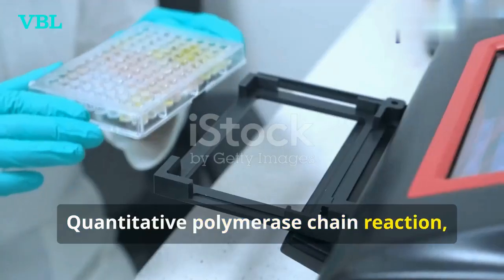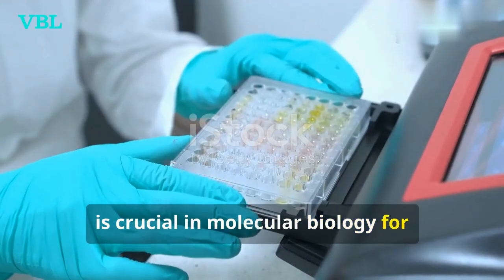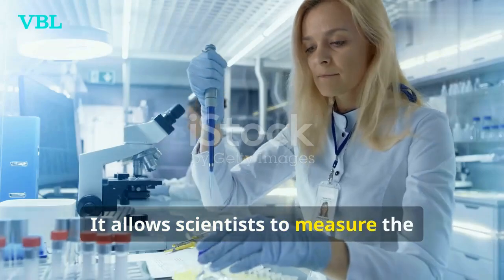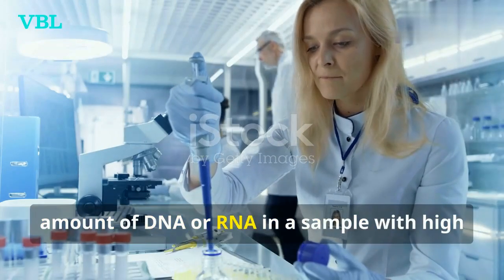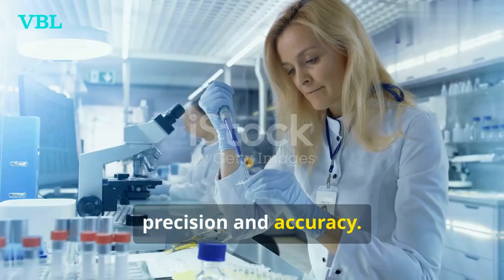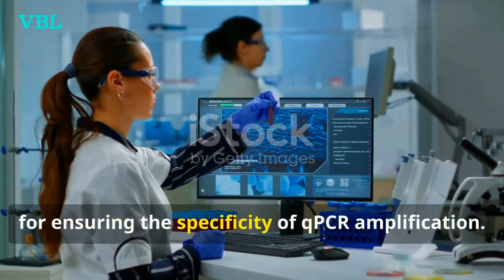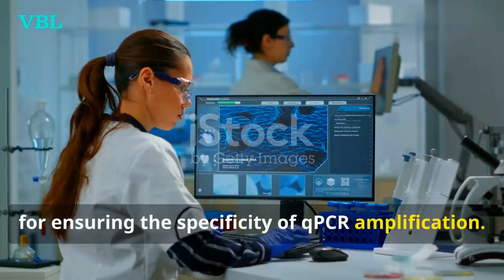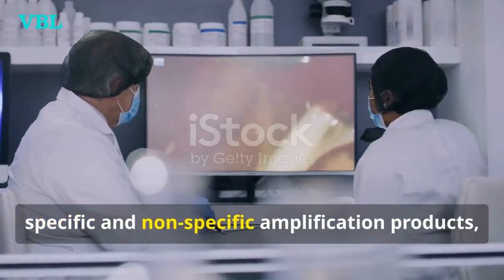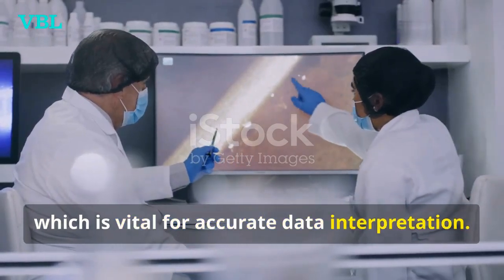Quantitative polymerase chain reaction, or qPCR, is crucial in molecular biology for quantifying nucleic acids. It allows scientists to measure the amount of DNA or RNA in a sample with high precision and accuracy. Melt curve analysis is a powerful tool for ensuring the specificity of qPCR amplification. It helps in distinguishing between specific and non-specific amplification products, which is vital for accurate data interpretation.